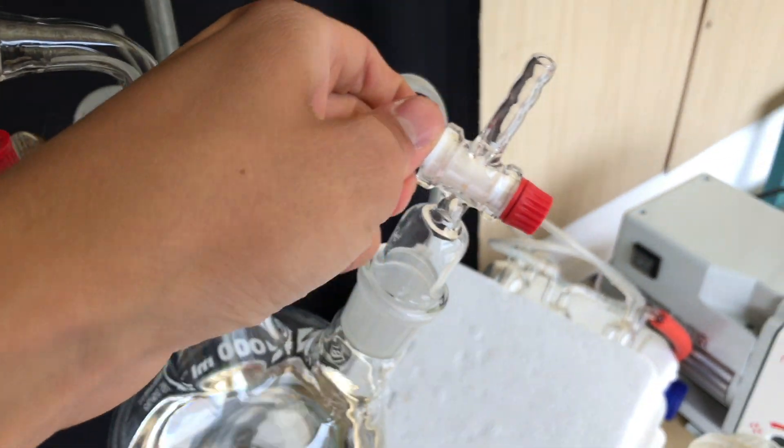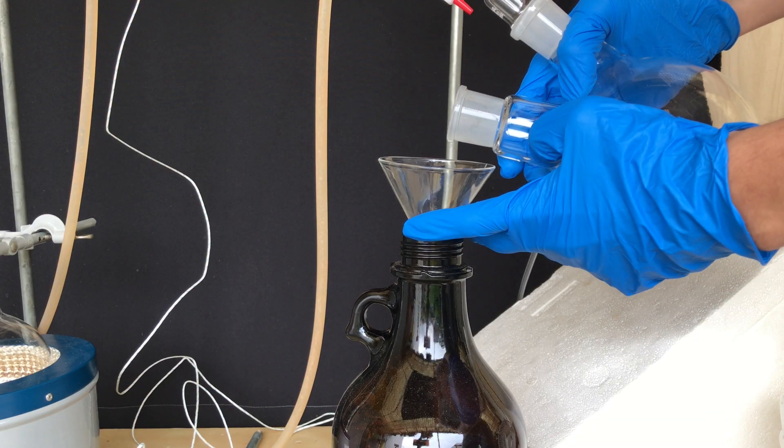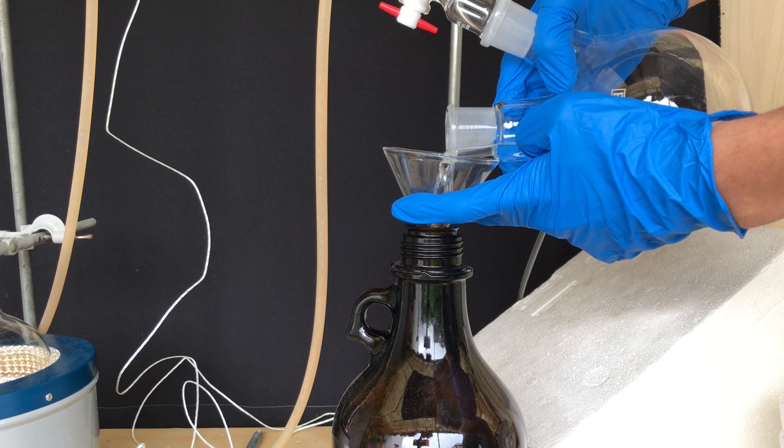At some point there was a lot of bumping in the apparatus and the temperature reached about 56 degrees celsius, therefore we stopped the heating and let air back into the apparatus.